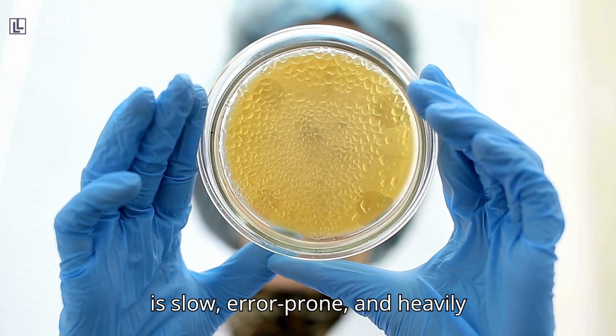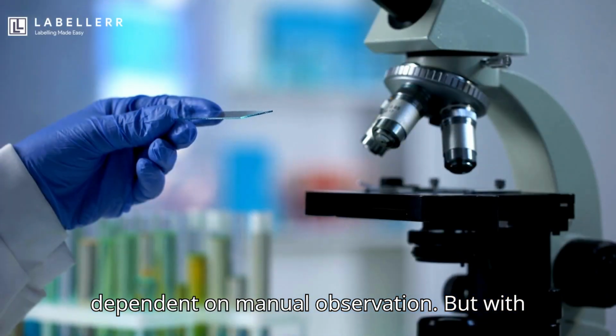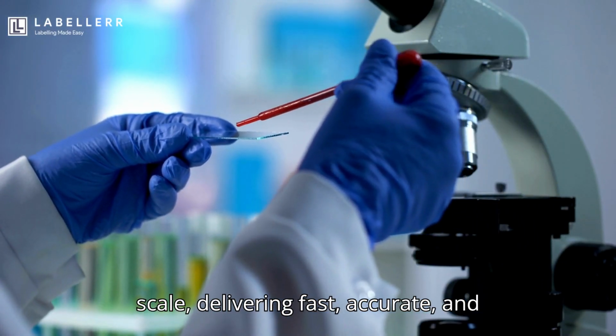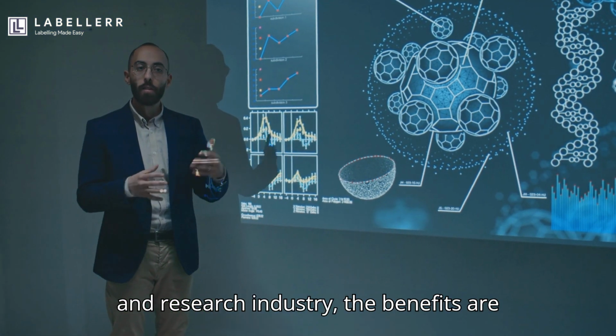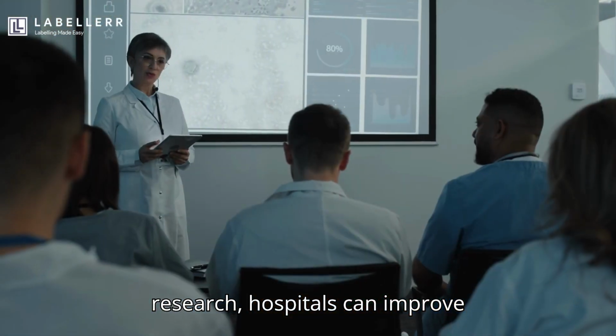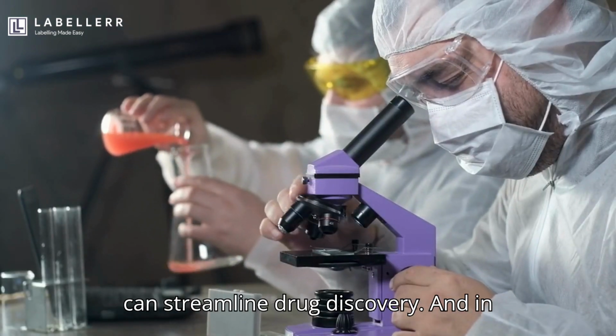Traditional cell counting is slow, error-prone, and heavily dependent on manual observation. But with computer vision, we can process images at scale, delivering fast, accurate, and repeatable results. For the healthcare and research industry, the benefits are significant. Labs can accelerate medical research, hospitals can improve diagnostics, and pharmaceutical companies can streamline drug discovery.